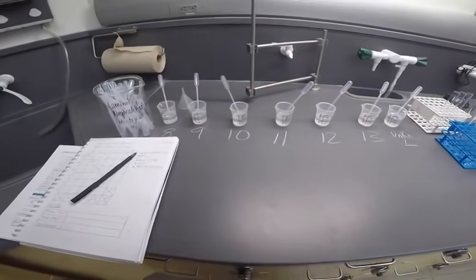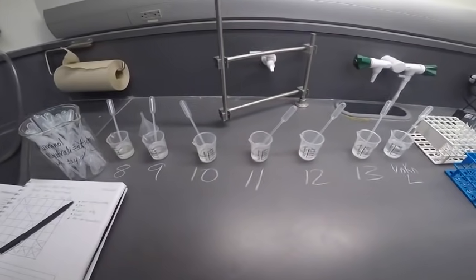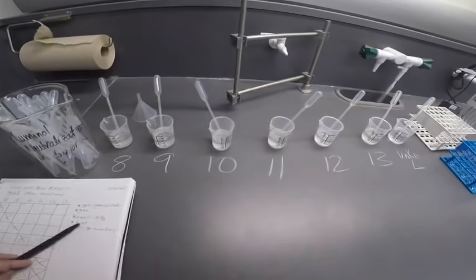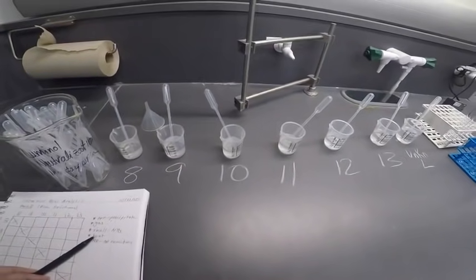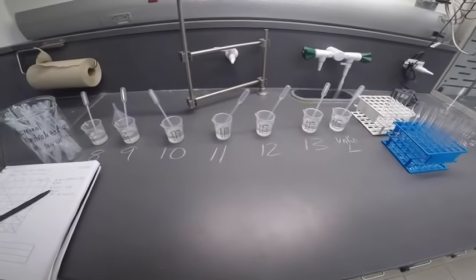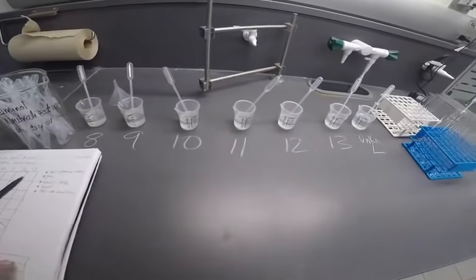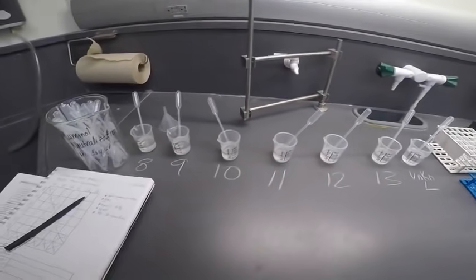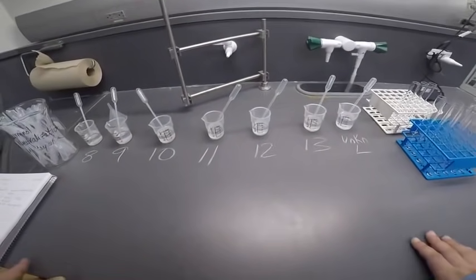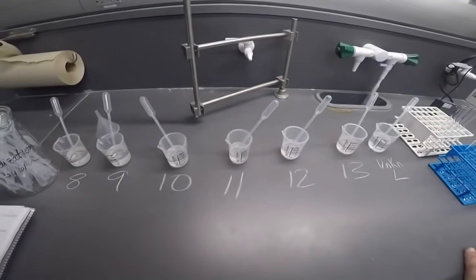So you might see a precipitate, gas formation. So we'll observe bubbling if we have gas formation. Also a smell. So I'll be checking each of these for smell safely by stirring with a wooden applicator stick and wafting the smell towards my nose. And the smell is an indication that ammonia has been formed, ammonia gas, which won't bubble as a solution because it's actually fairly soluble in water. However, we'll be able to detect it by its smell.